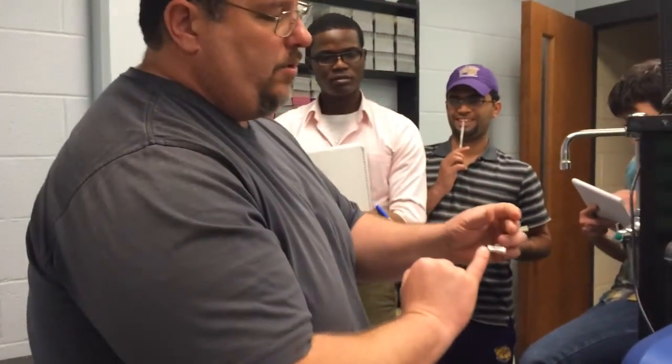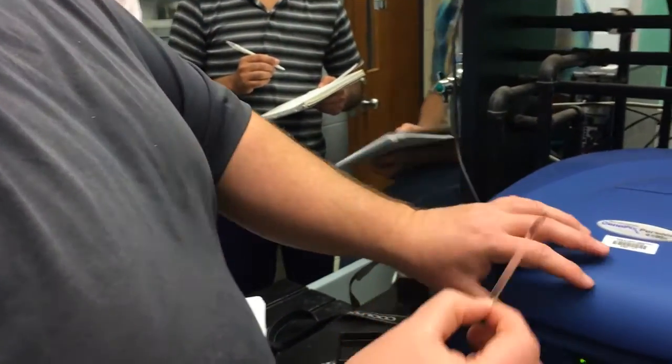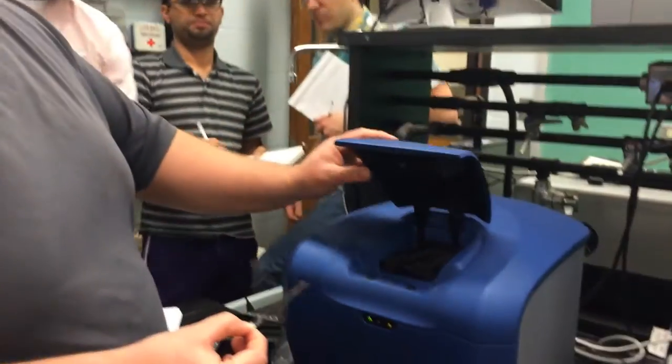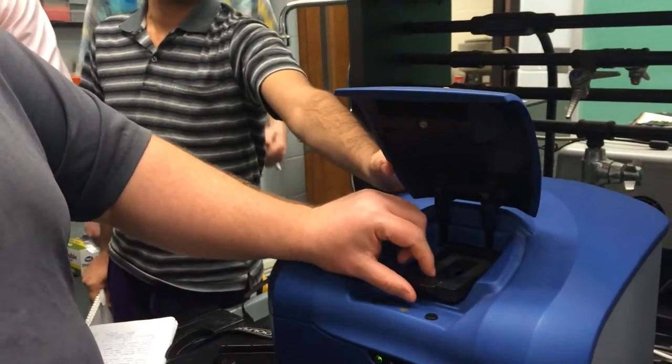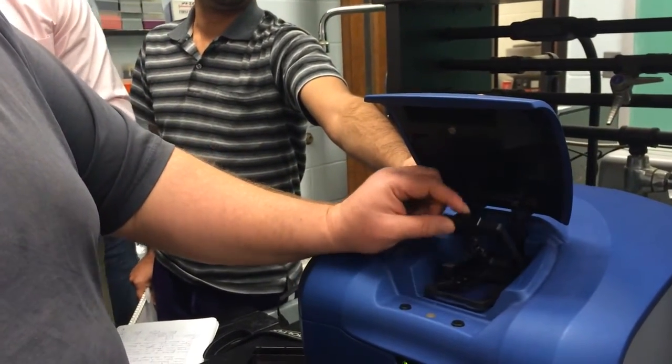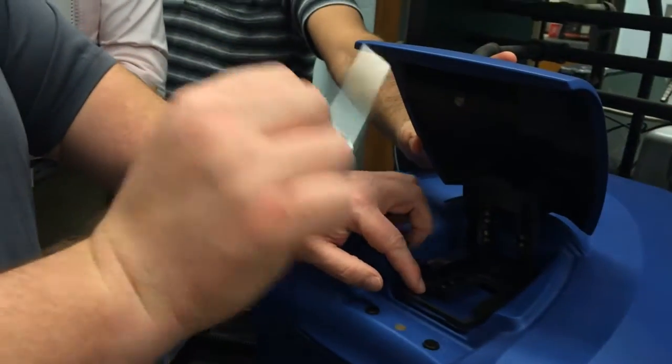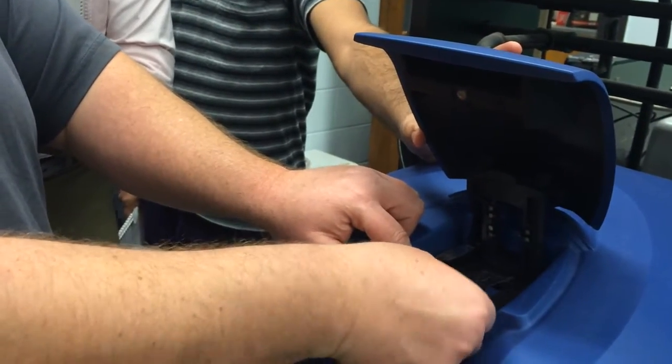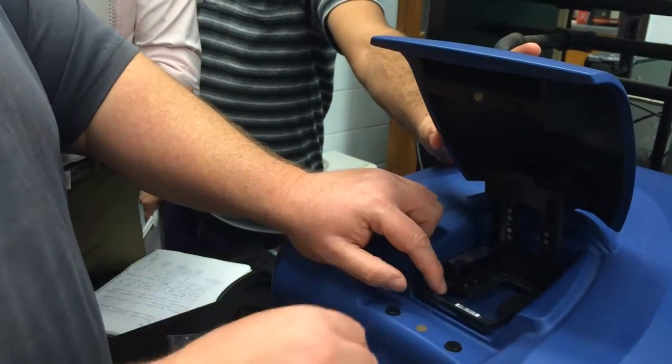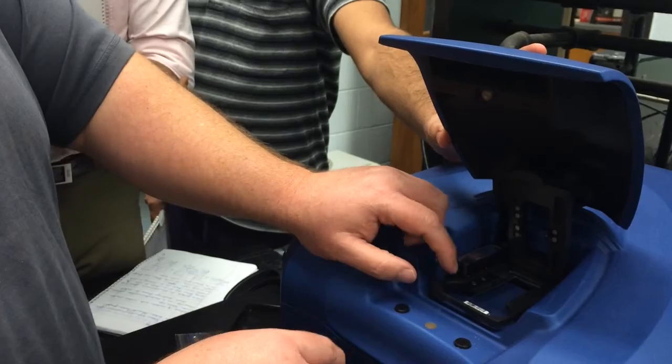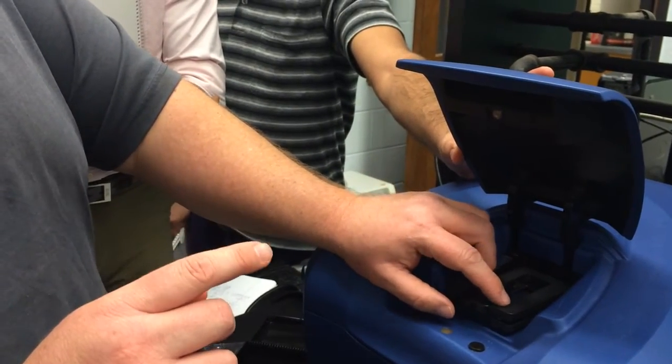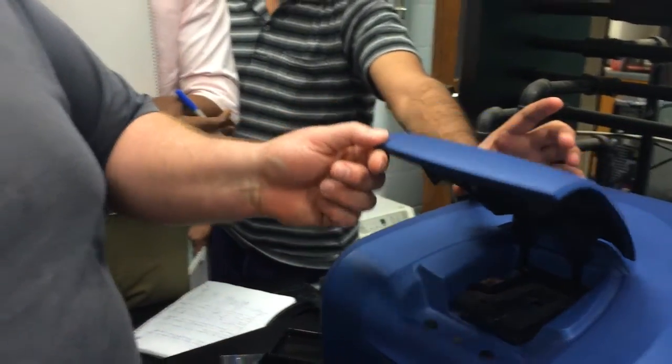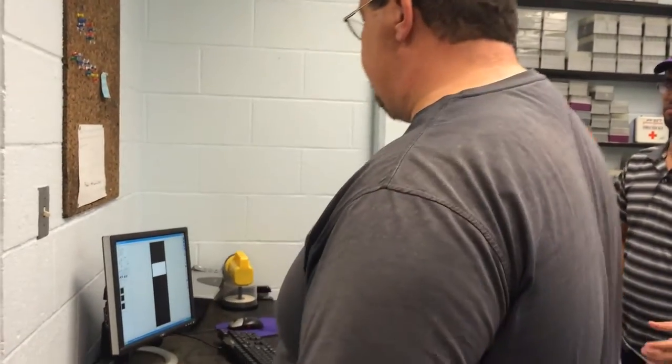Now you'll notice that there's labeled sides. And so the Agilent side is going to actually be pointed down. We open up the lid. This lid actually kind of falls, so I'm going to put an extra hand there. And then I'm going to open up the slide carrier and put the Agilent side down. That's the side that was actually printed in this particular chip. Each chip could be a little different. I'm going to make sure it's seated nicely and I'm going to close it. And then I'm going to make sure that this closes and clicks. And then I'm going to gently shut the lid. And now we're going to scan the chip.